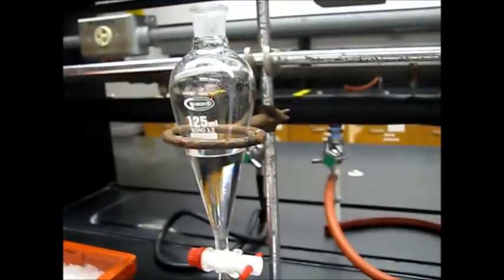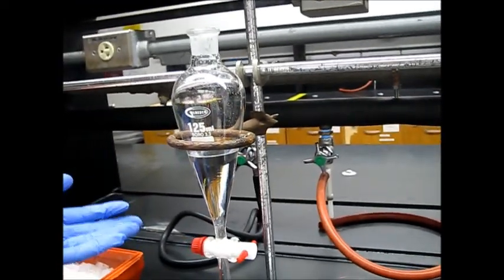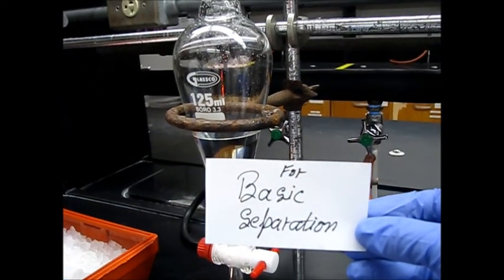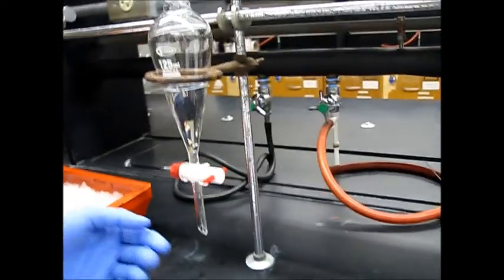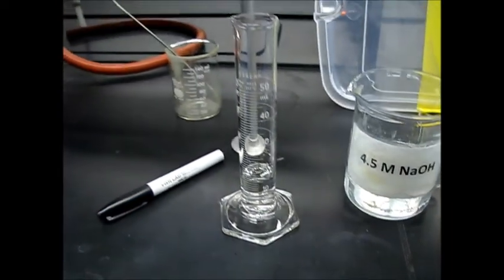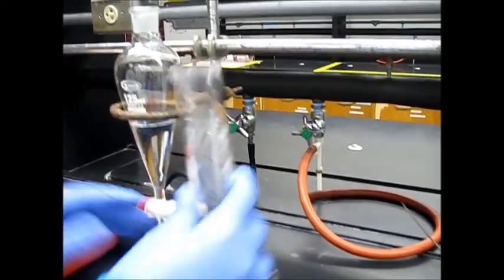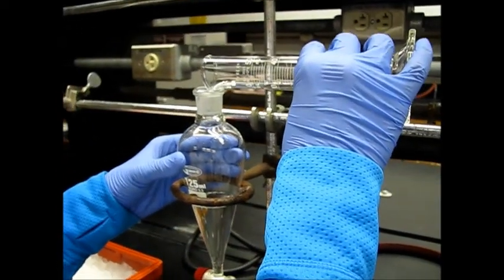The ether layer contains our benzoic acid and naphthalene compounds, which is for the basic separation. We will now add 15 ml of 4.5 molar NaOH, which will basify the solution. This is the second extraction — the basic extraction.